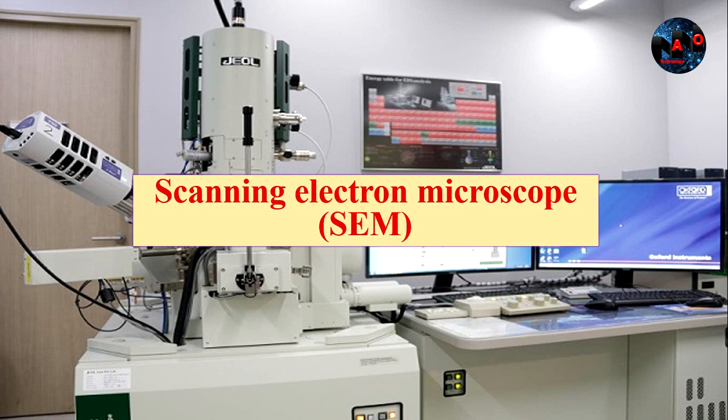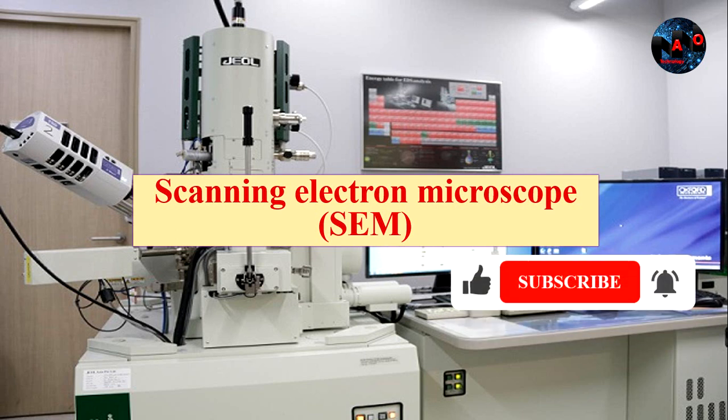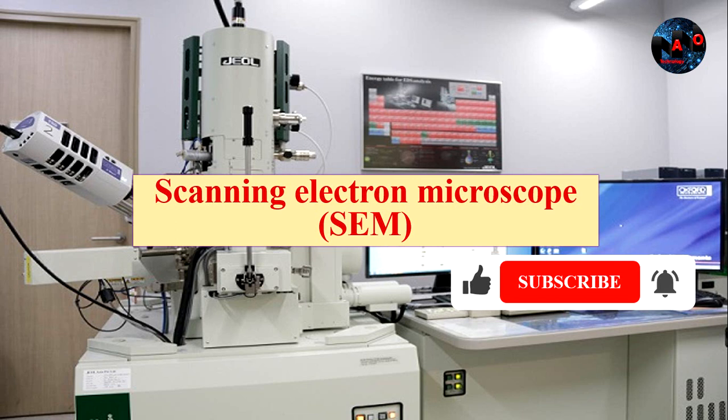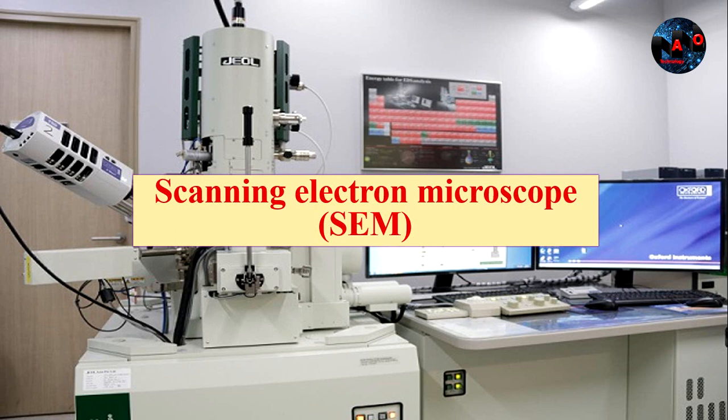In the previous video, I explained the microscopy-based nanoparticle characterization as well as advantages and disadvantages of imaging with electrons. A scanning electron microscope is the technique of choice for analysis of a specimen surface.